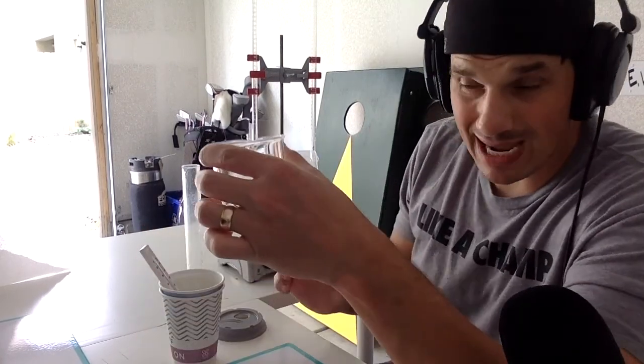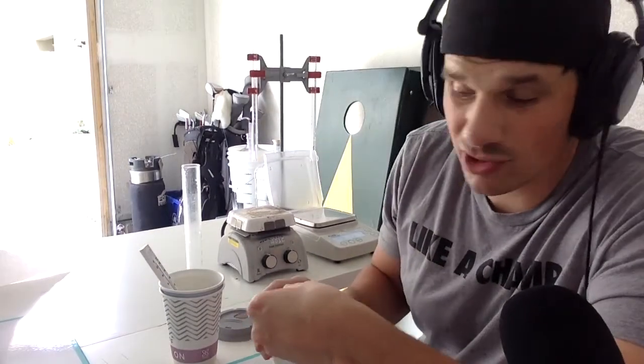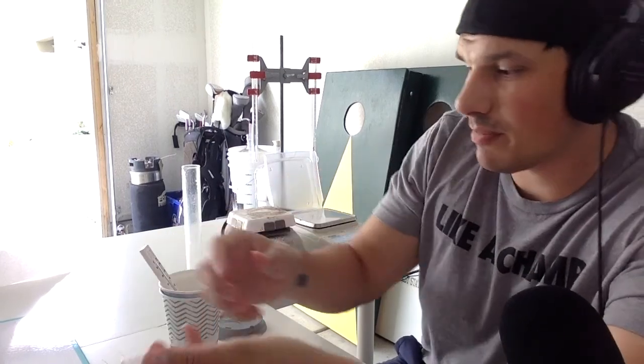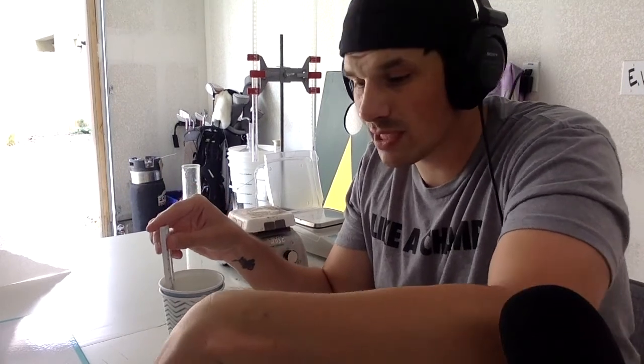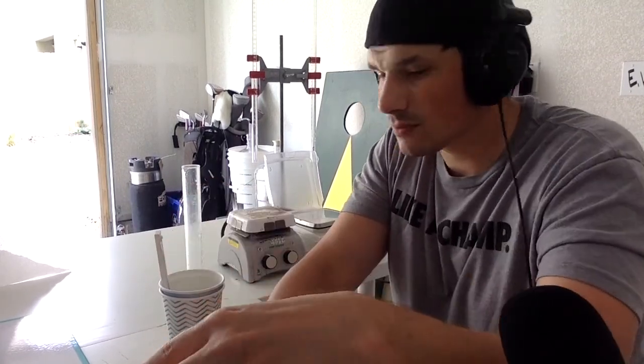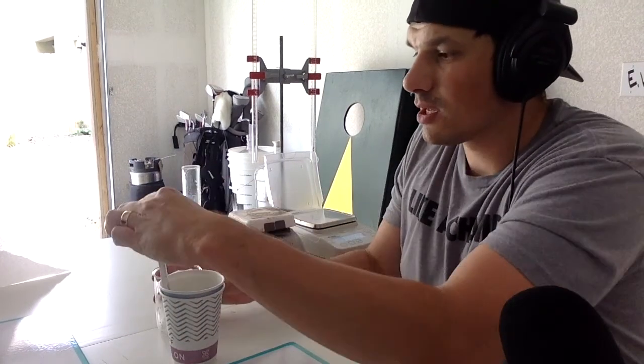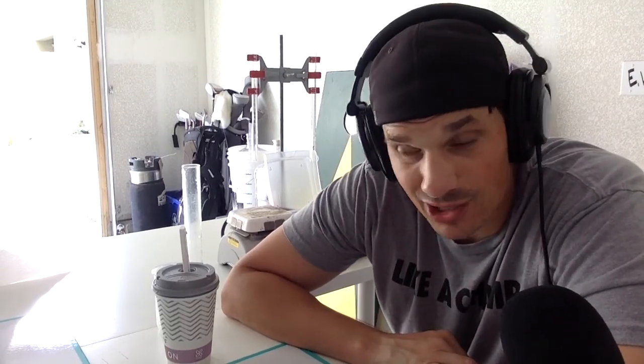All right. So I'm going to throw my ice in. Now I'm not going to use all the ice here, mainly because I only have 100 milliliters of water. So I technically only really need 100 milliliters of ice. So I'm going to throw in about four ice cubes here. Four should be enough. Let me see when it's going to melt. So let's close my system up and this is going to take a little bit of time. So what I'm going to do is I'm going to pause the video. When we come back, the ice is going to be melted. And then I'm going to show you what our calculations are going to be.